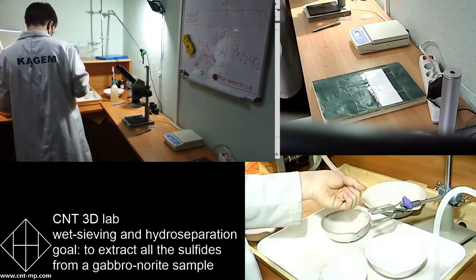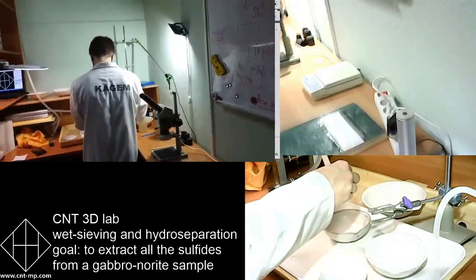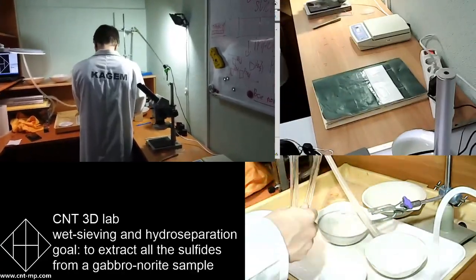You can also use automated sieving, which is more expensive in terms of capital.